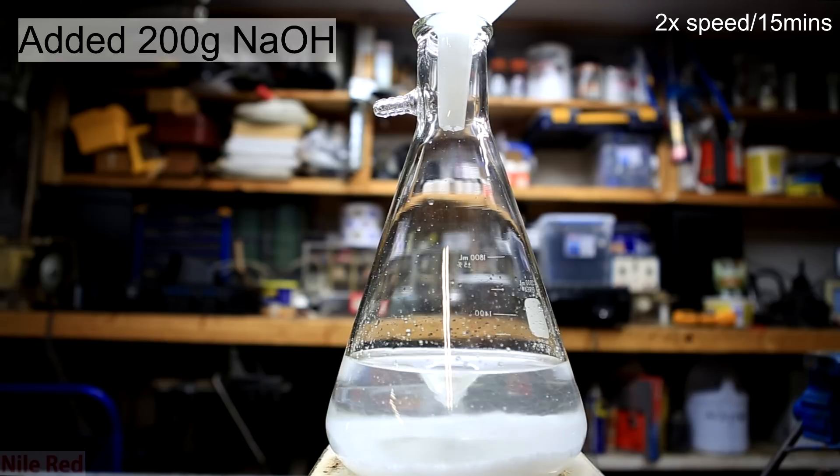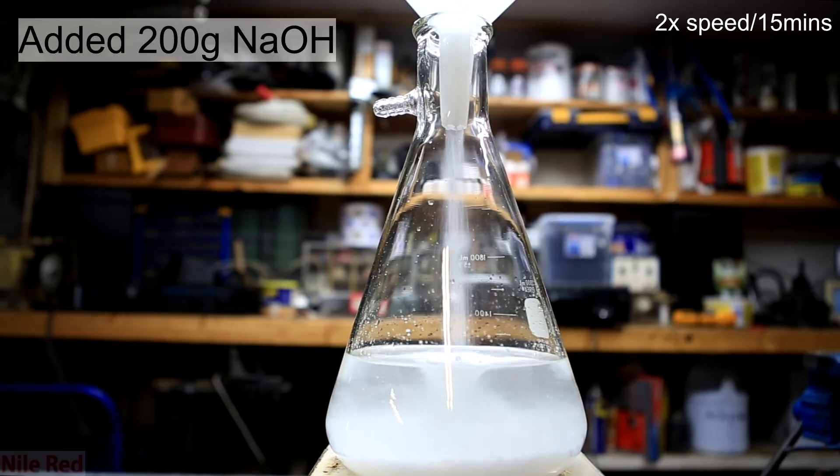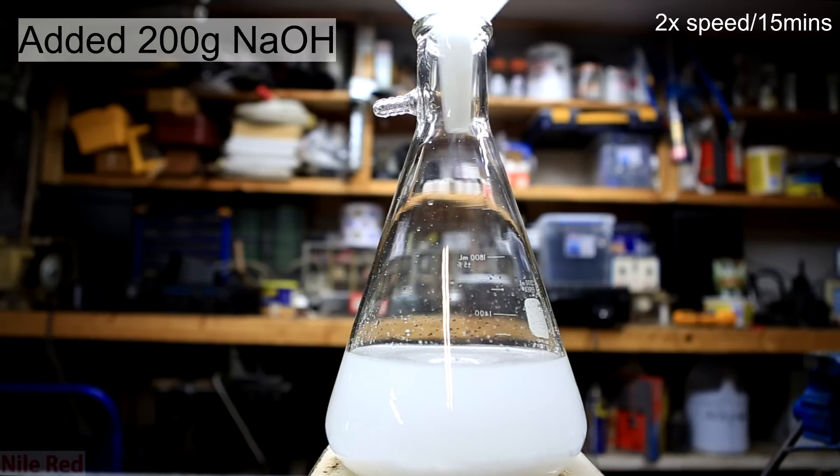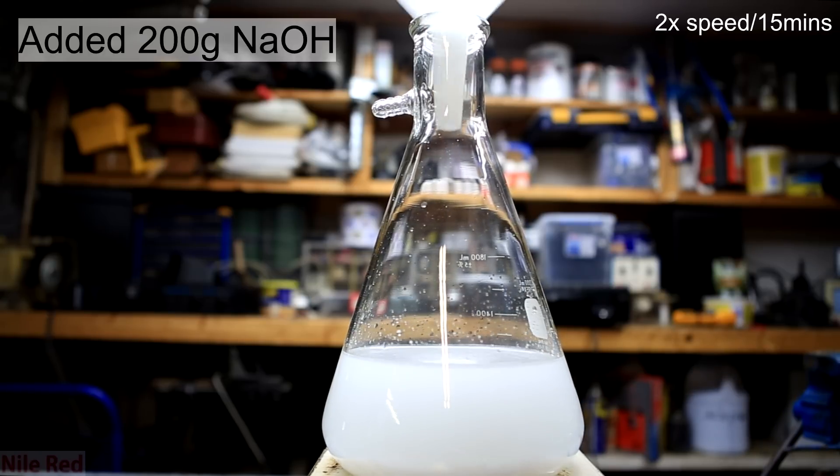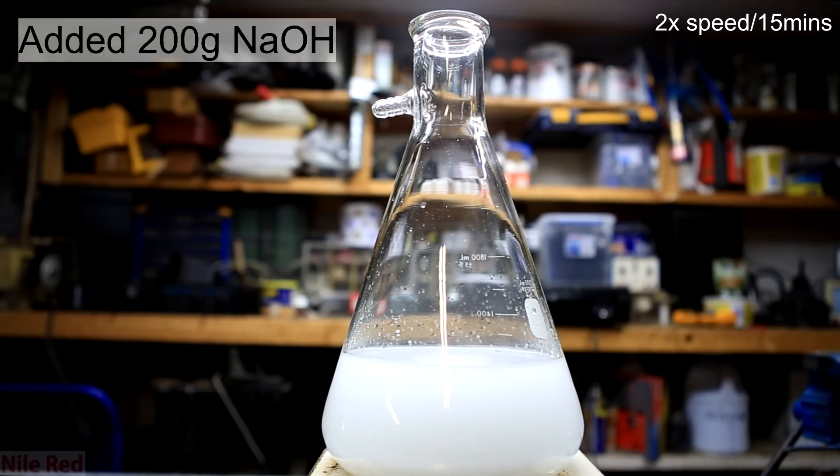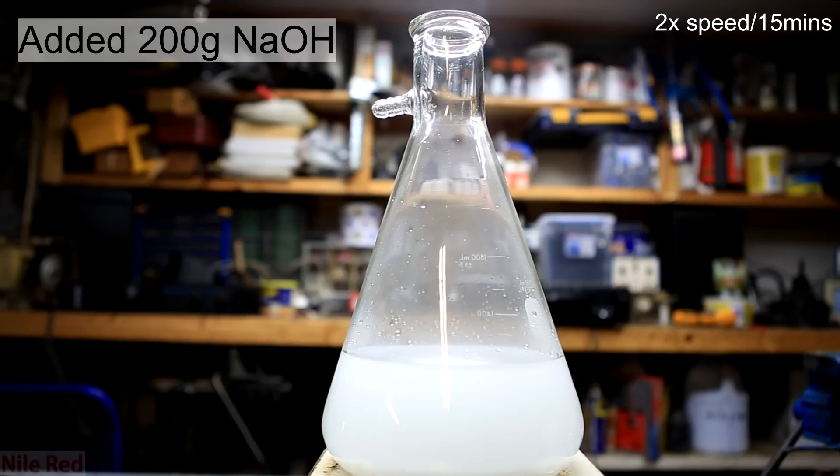You can use less or more, it doesn't really matter. It all depends on how strong you want your base bath to be. Also I use sodium hydroxide but it's actually more common to use potassium hydroxide. With strong stirring the sodium hydroxide was allowed to completely dissolve until the solution became totally clear.